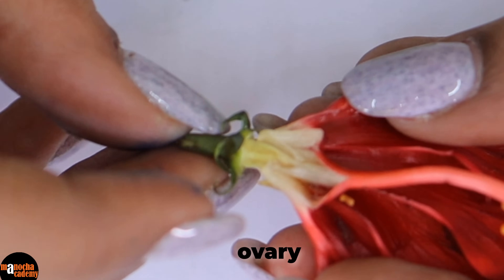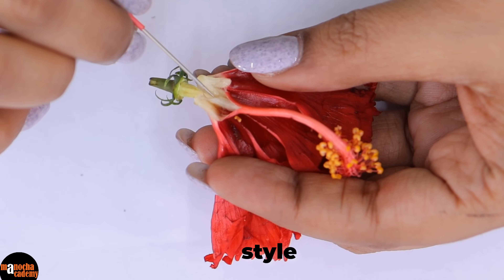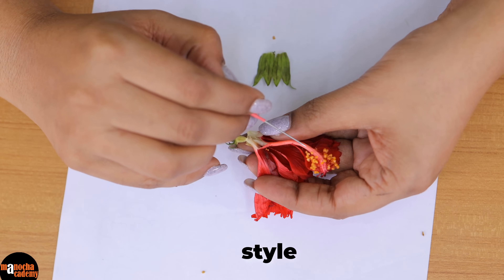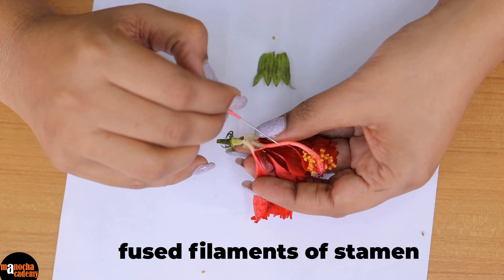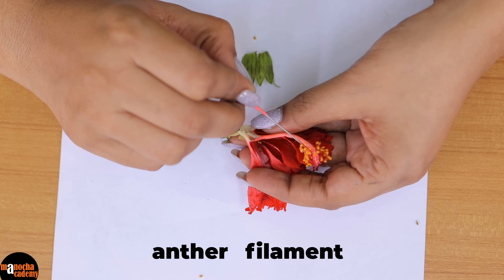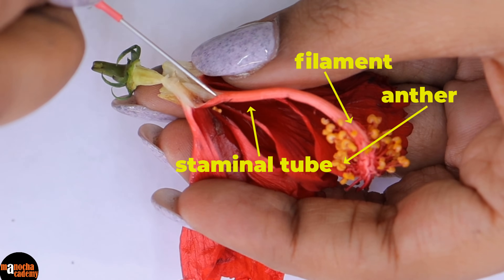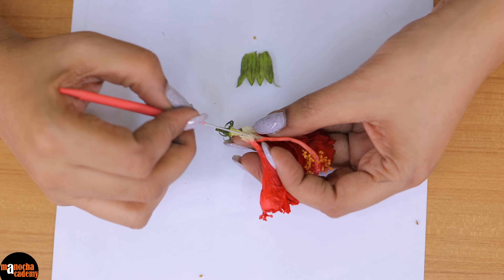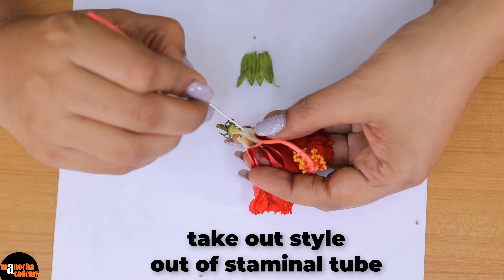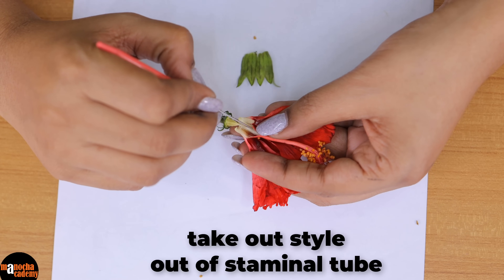In this flower the ovary, which is a part of the gynaecium, is present at the base. The style, which you can see right here as this white stalk, runs through a tube. This red tube is made up of the fused filaments of the stamen. The stamen, which is a part of the androecium, has two parts: anther and filament. These yellow lobes that you can see here are the anthers, and the filaments have joined together to form a tube which is known as the staminal tube. My job here is to take out the style from within the staminal tube, which is a slightly difficult and delicate task requiring patience and care with the pressure applied.